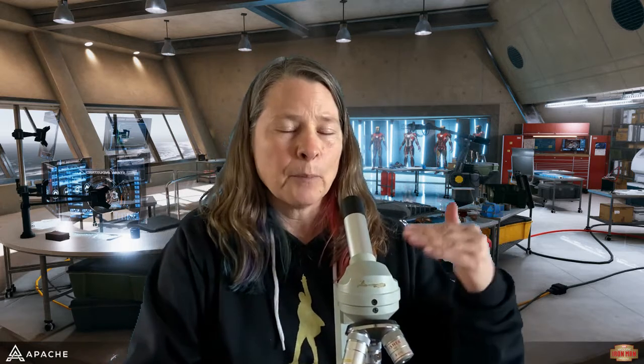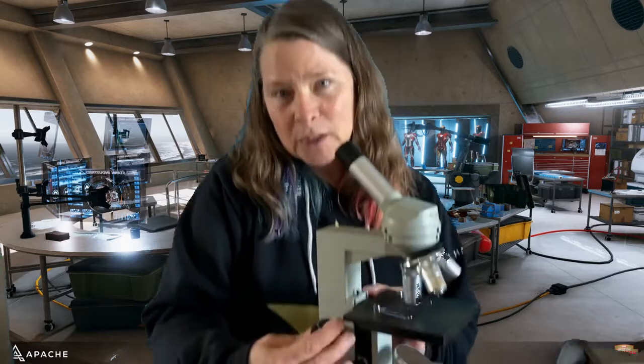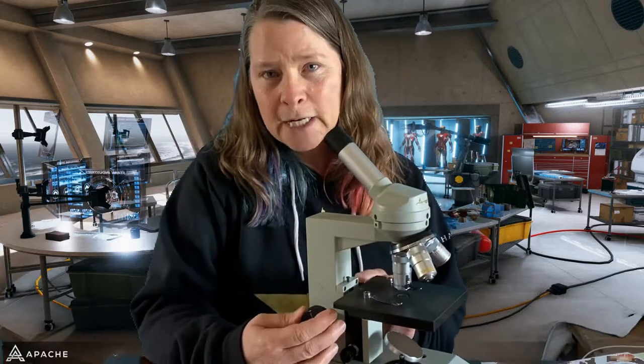You're just going to have to watch what I do, and I'll explain how I would normally do this in class. So the thing that you're going to be filling in Canvas is just filling in the parts of the microscope. And when we use the microscopes, I will be referring to them by their actual name. For example, this part here that twists back and forth, this isn't the twisty turny thing. We're going to name it and use that name, okay?